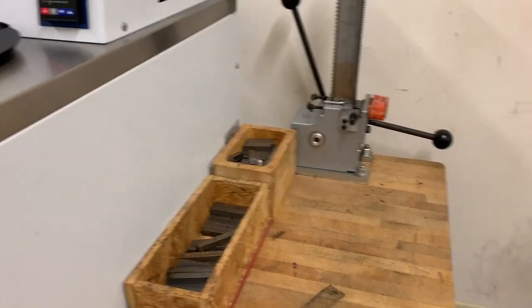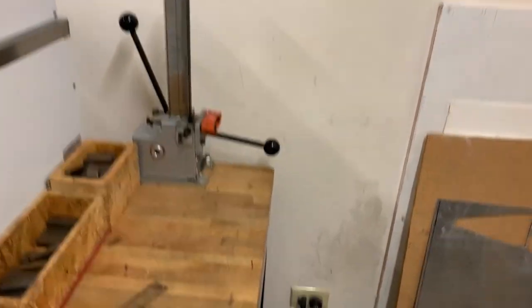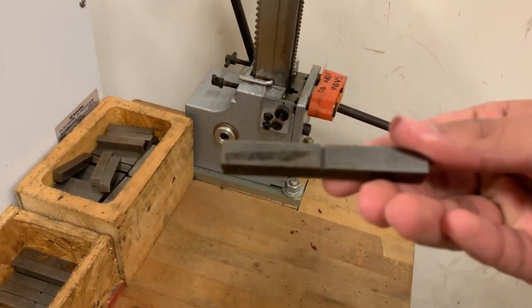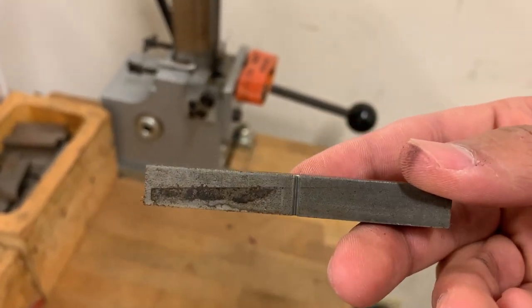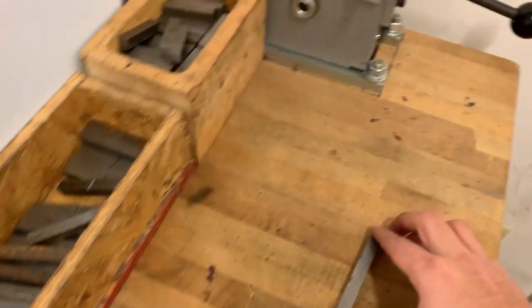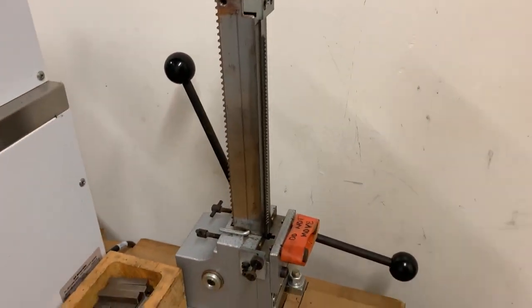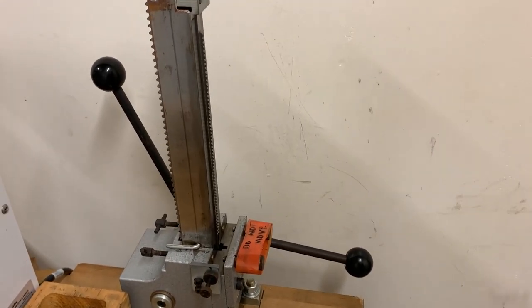Part of the ASTM standard that we need to use for this impact test is that we need to notch our samples. We need to give them this kind of notch — you can see like this one — we want to make this little notch in our sample. That's what the ASTM standard requires when we are going to be doing the impact test. Our samples so far do not have that, so we will be using this notch indenter.